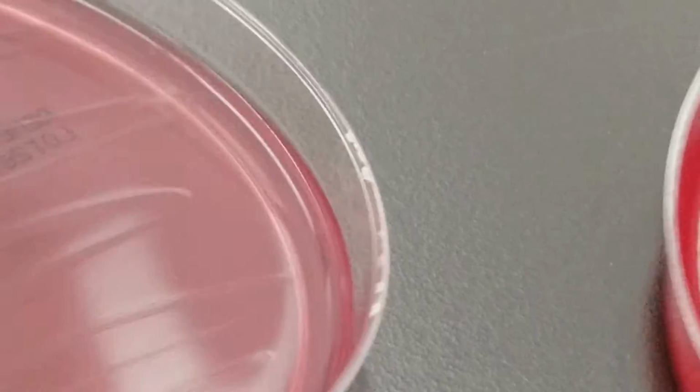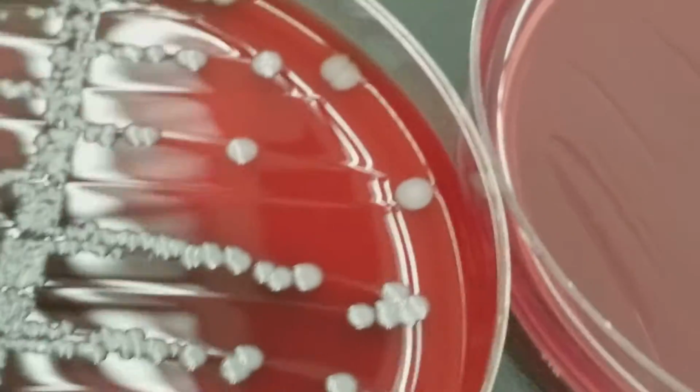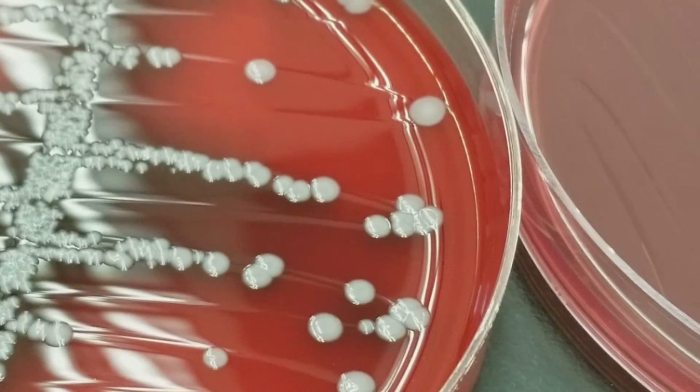This one is a urine, and when we think about urines, we do have microflora that's close to the opening of the urethra, which is basically the section before the urine actually is out of the body. So when we talk about UTIs, that's where they're going to start.